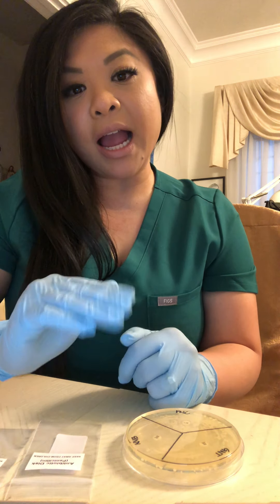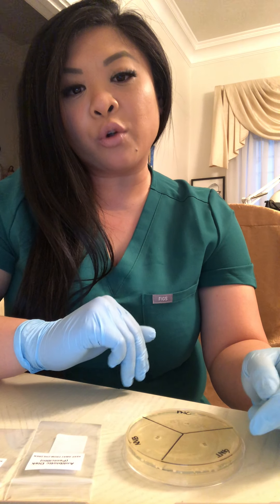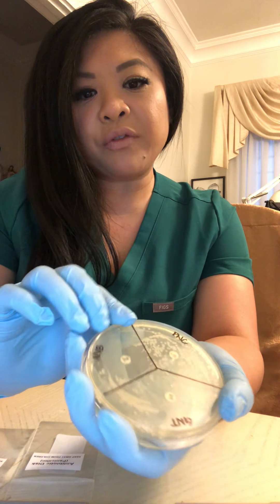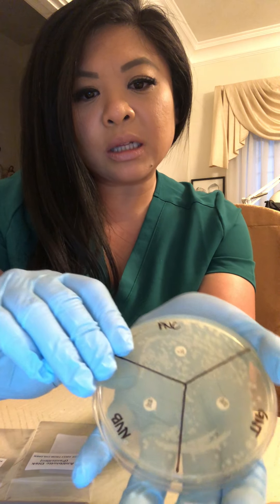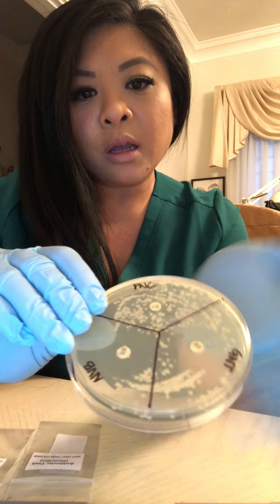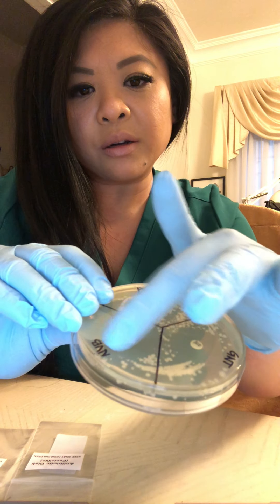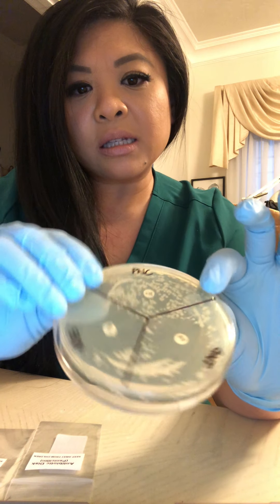Kirby Bauer Diffusion Test Results and Reflection. I actually incubated my agar plate for more than 12 hours — over 24 hours — because at the 12-hour mark there was very little growth, more like a lot of specs. I will show you since I have my gloves on. There were very few colonies that formed. I have some colonies here and some colonies here, and that's about it.